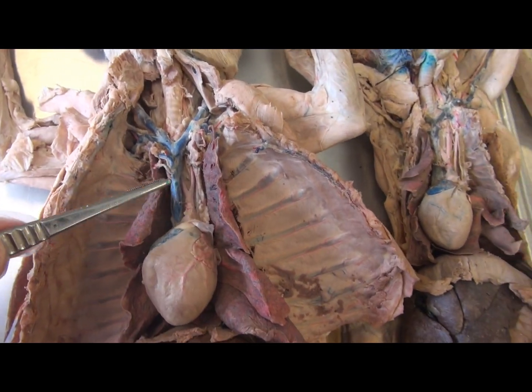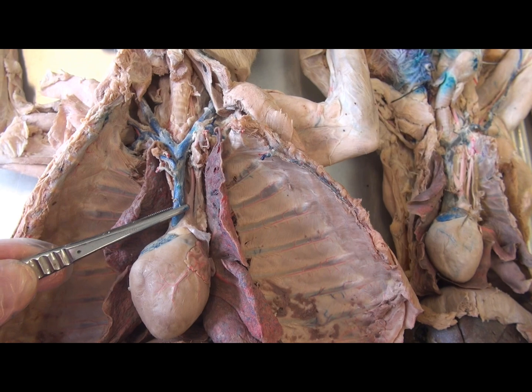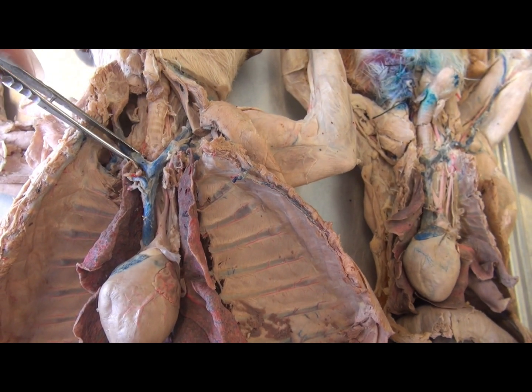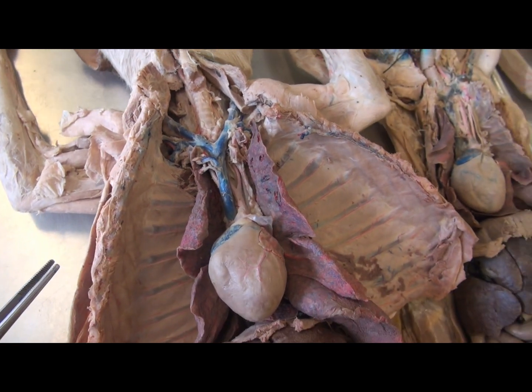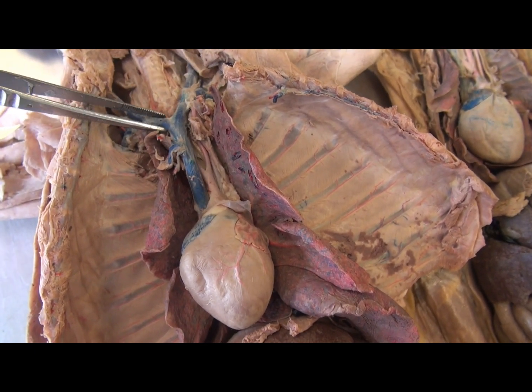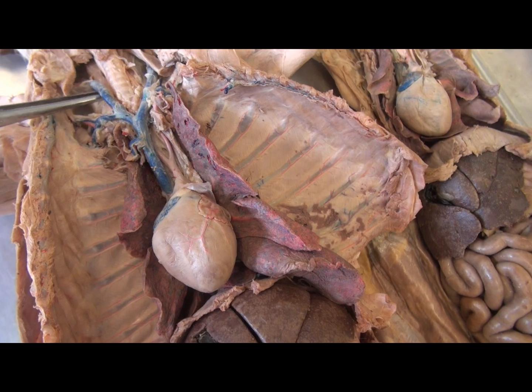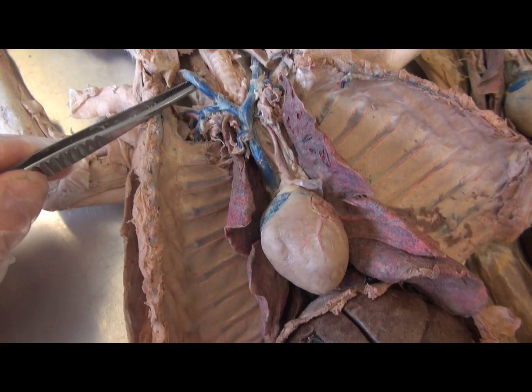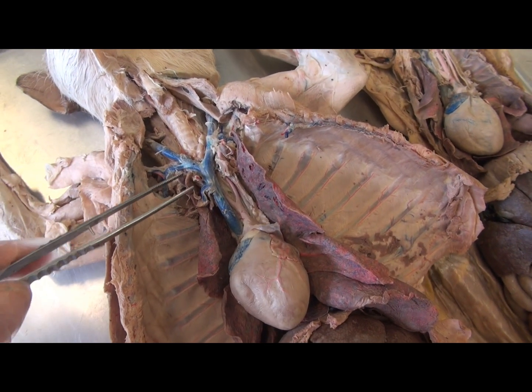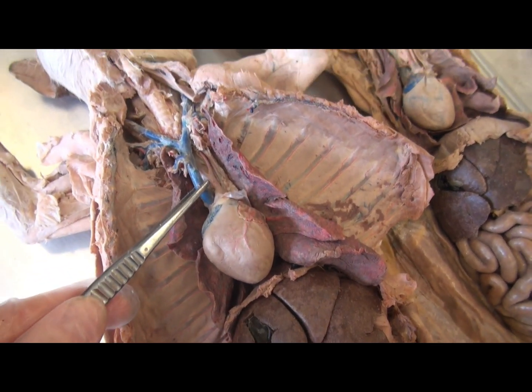When one imagines the letter Y twice, the first Y is formed when the superior vena cava joins the heart and branches into two brachiocephalic veins. Notice that the brachiocephalic veins are symmetrical, unlike the brachiocephalic trunk. In arteries there is only a brachiocephalic on the right side, whereas there is a brachiocephalic vein on both the right and left sides. From the brachiocephalic veins, a second Y is formed by the jugular — which drains deoxygenated blood from the head — and the subclavian vein. So the subclavian and jugular veins fuse to form the brachiocephalic vein, and the left and right brachiocephalic veins fuse to form the superior vena cava.